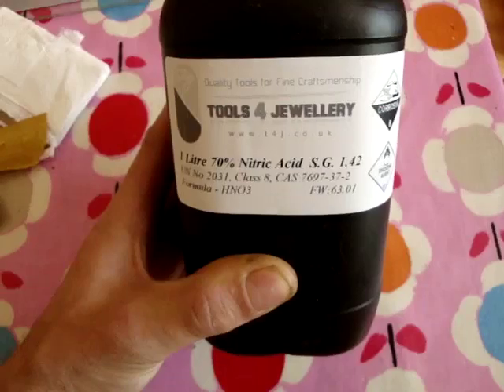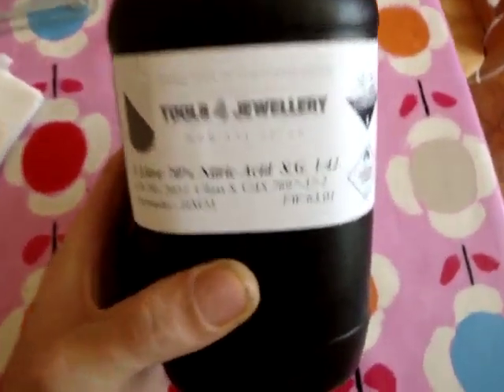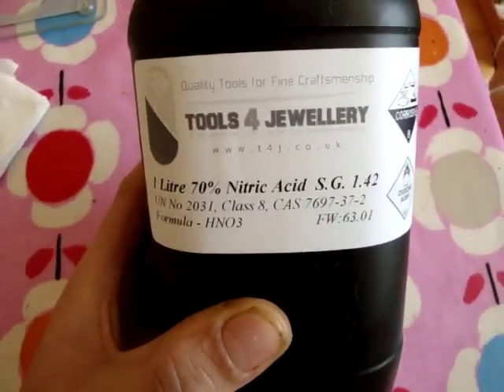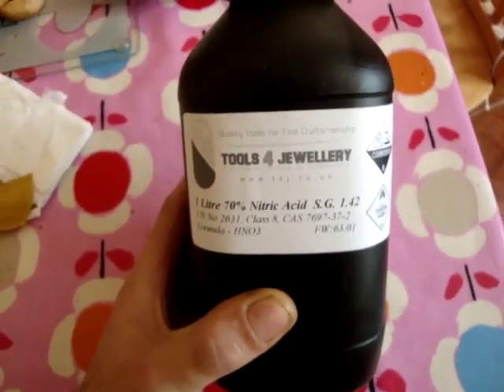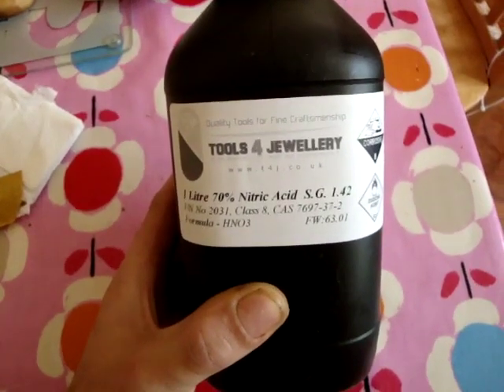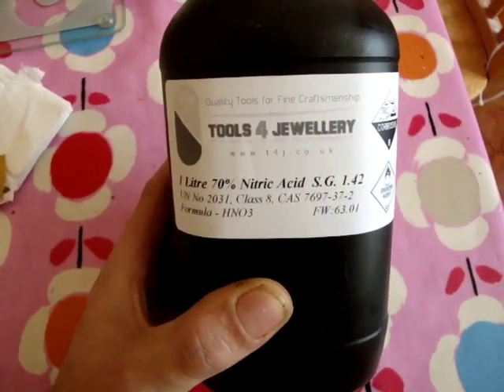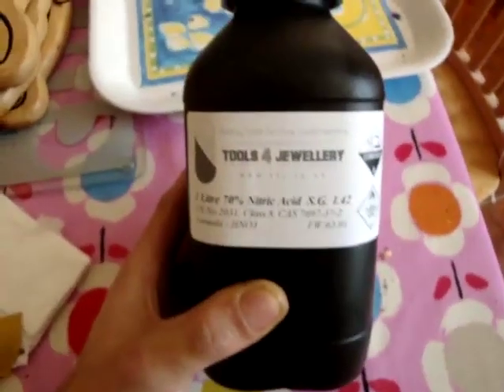This is quite exciting stuff. Also, very corrosive, okay? There's no messing around with this stuff. If you're not careful, liquids in particular splash. So take some precaution out there. You've only got a couple of eyes, and if you burn them out, they don't work - that's the way I look at it.